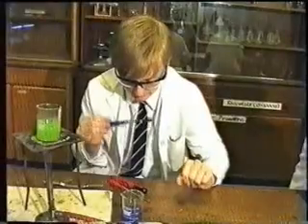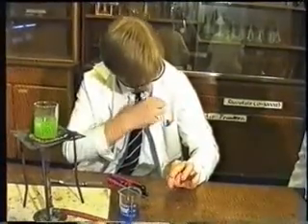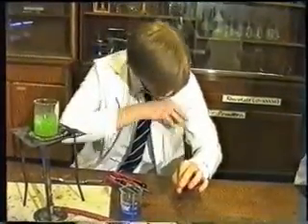Look at the pictures. Good boy, wearing his glasses near an open flame. Bound to have safe and healthy vision. Bad boy, didn't wear his glasses, probably now dead. Good boy, wearing his glasses, live a long and healthy life with good clear vision, may even have children if you can shake off that geeky image. So remember, always wear your safety glasses.